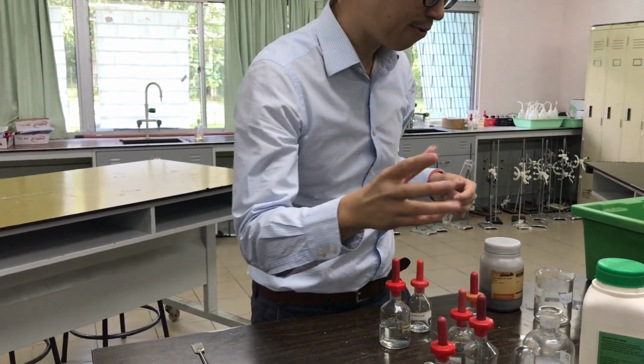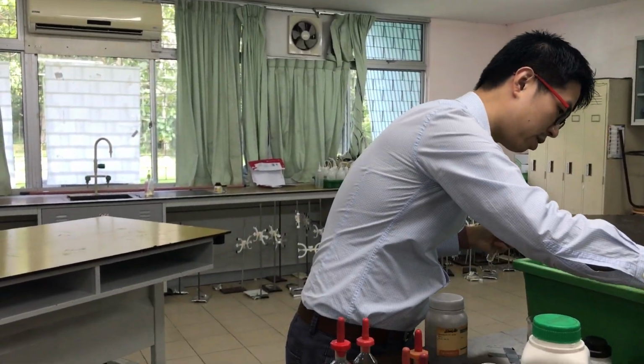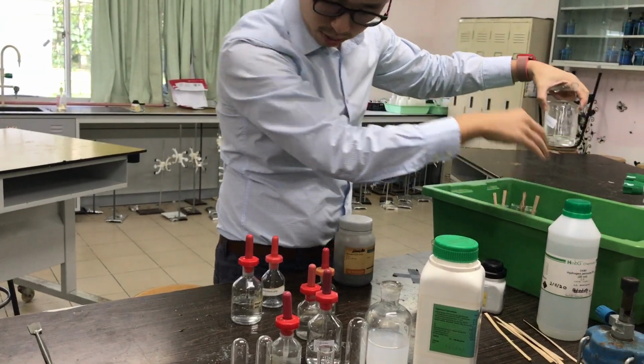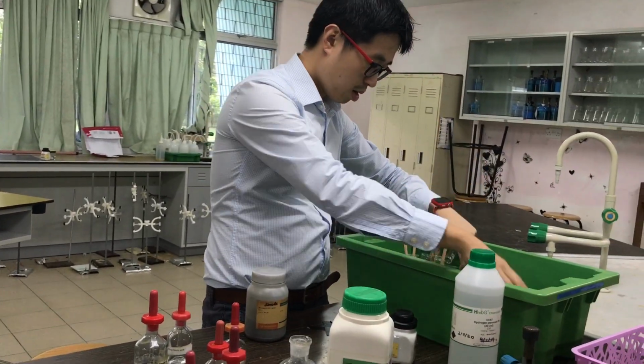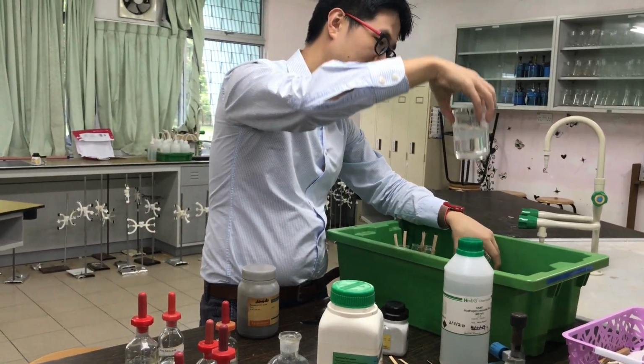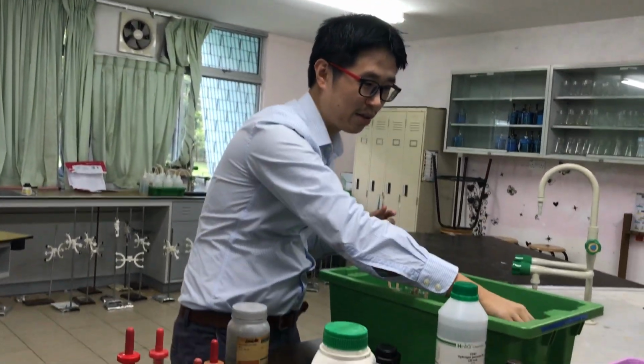Where was my ammonium sulfate just now? Yeah, my ammonium sulfate is ready. Where was my ammonium? Okay, but do you remember the test for ammonium from yesterday? Yes. I really don't have enough ammonium, so I don't get to show you ammonium.